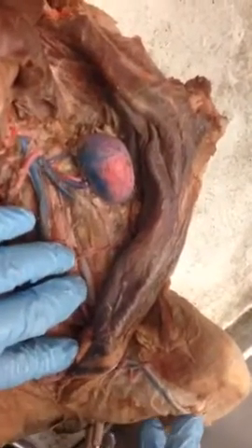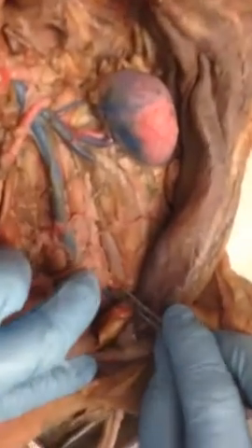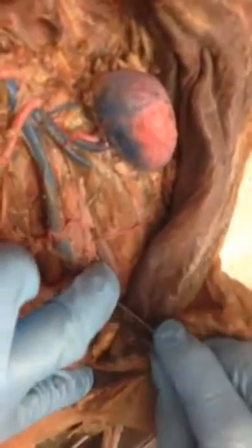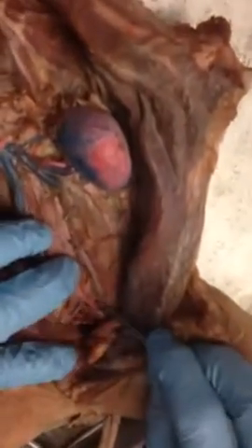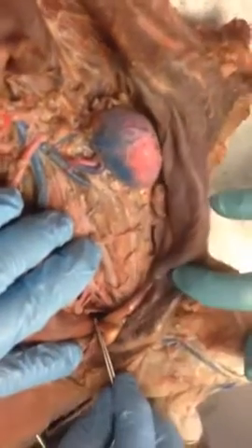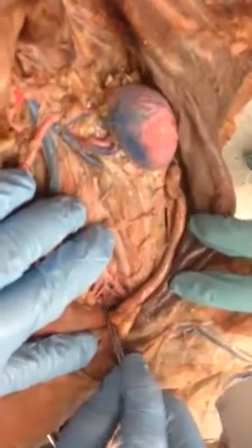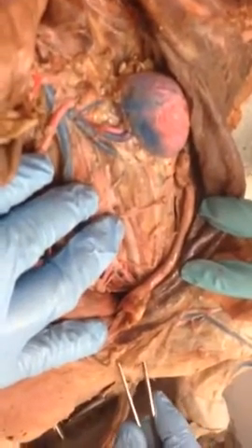In cats we have to fudge it now. It doesn't really work for cat. Because then we have, see how it's external and internal. A V, and then there's like a Y structure. Can you see that, sweetie? So then we have external and internal iliacs. And this, we don't have to know that one. The Y is the internal, right? And the V is the external?